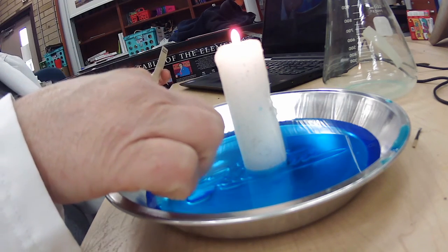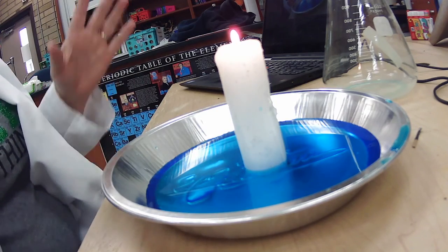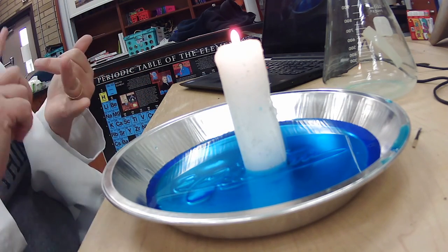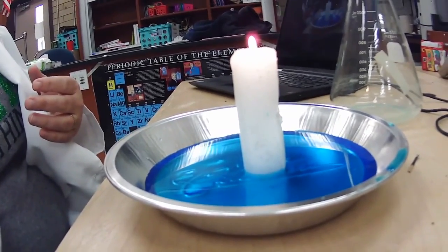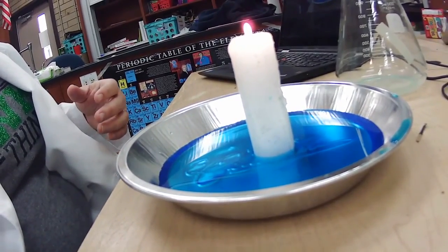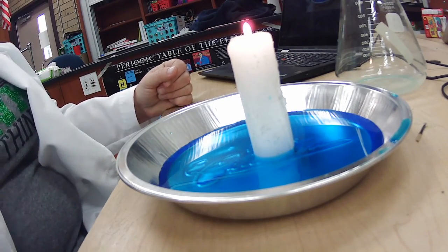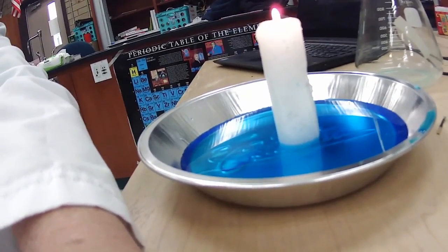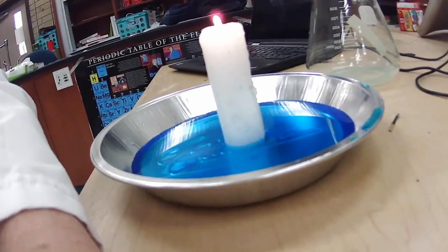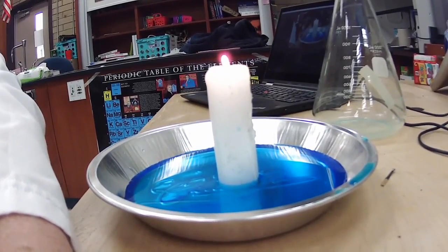gas lab. I'm going to dip that in there just to get that out. So we're talking about gas lab. So the things that are changing are pressure, temperature, or volume. And we're dealing with only gas, so don't worry about the liquids. We're actually dealing with gas. So we're going to let that burn for about 30 seconds. We're going to get it nice and hot. Okay, so what is changing here? What is changing about the gases maybe in the environment or in the air?